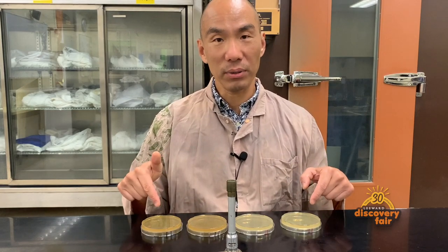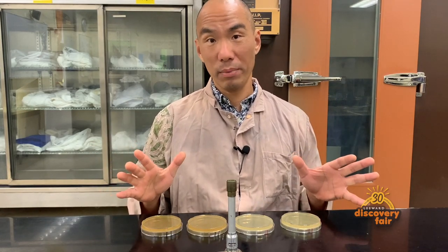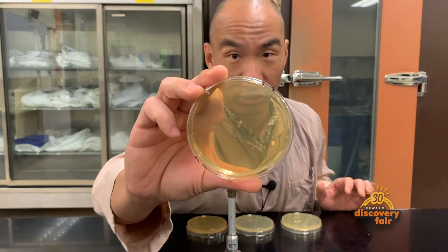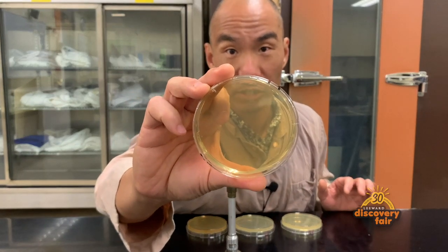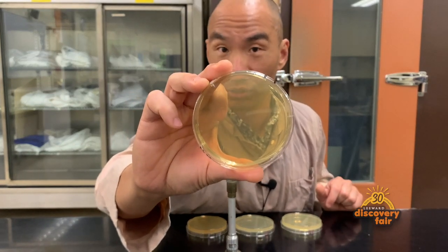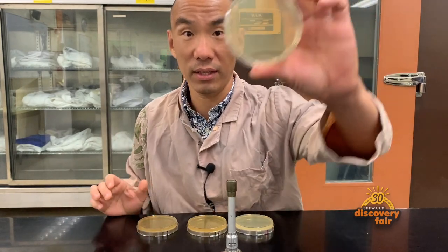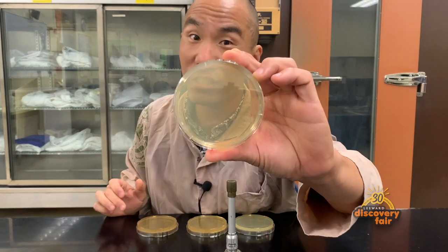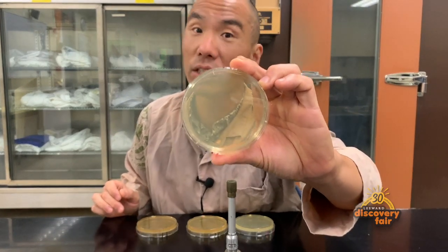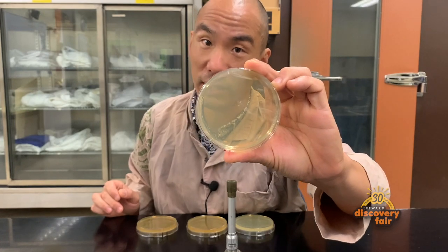These are agar plates. Agar plates are what we use to grow bacteria in the lab. This one has glucose as its main sugar. Glucose is a very simple sugar that bacteria get lots of energy from. This plate has sucrose as its main sugar. Sucrose is the sugar that you find in candy.